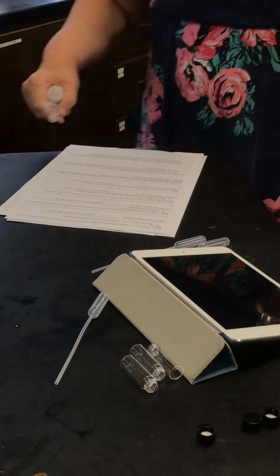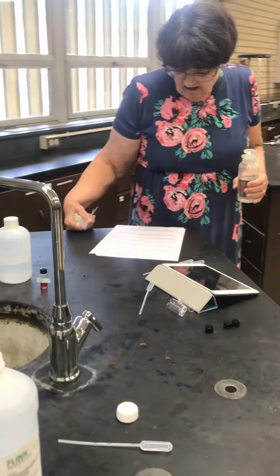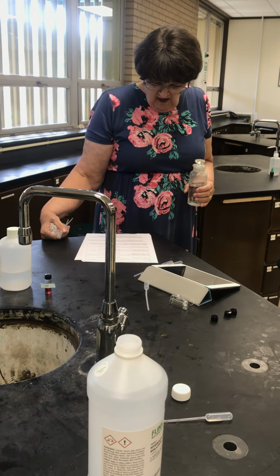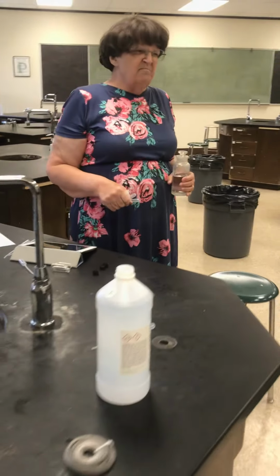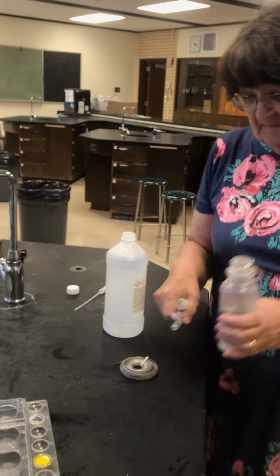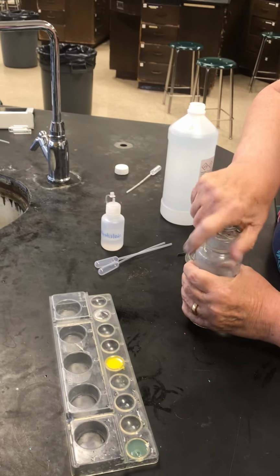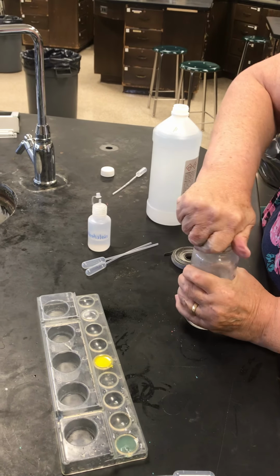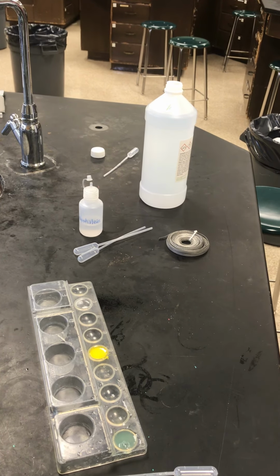Okay, last one. Oh, part L, nickel chloride and KI. It sits there and looks at you and does absolutely nothing. But let's try this one. Sodium hydroxide, if I can open the bottle. I can't open the bottle. Maybe I'll have to go get a different bottle.